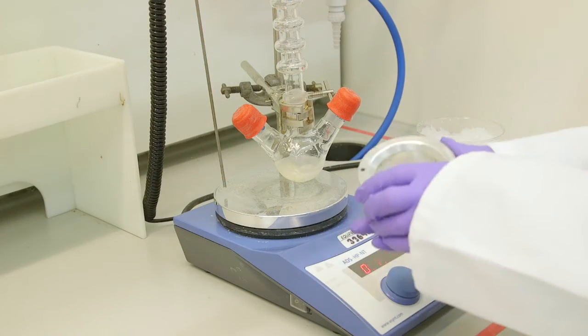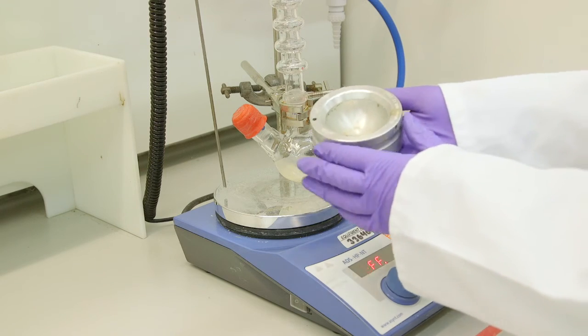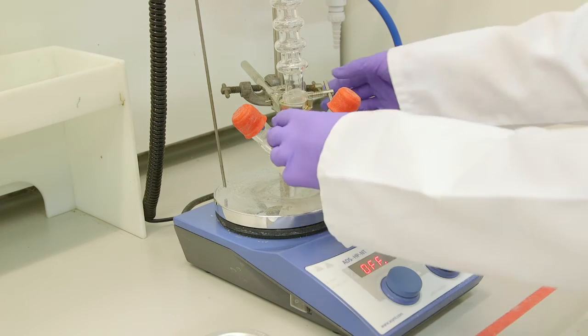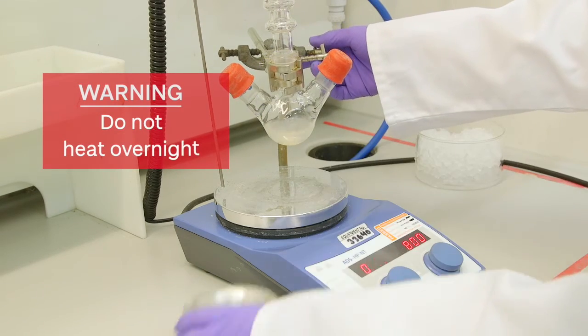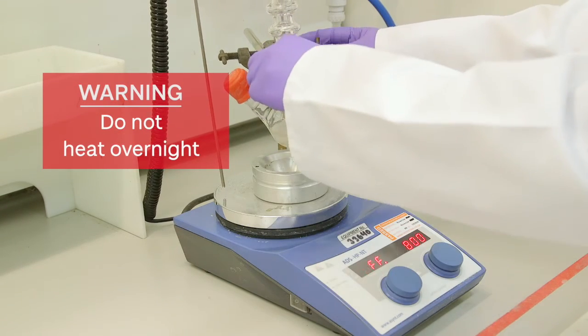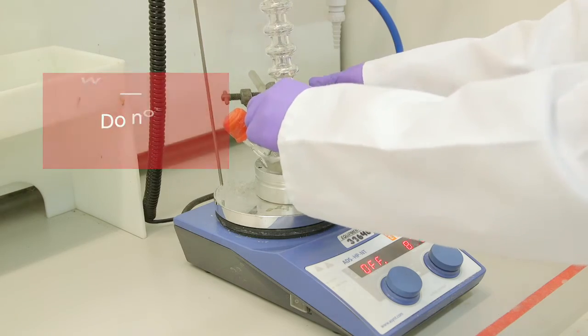After this time we will add a heating block underneath the flask so we can heat the reaction up to reflux. Do not leave the reaction to reflux overnight. You should only need to heat the reaction for a couple of hours.